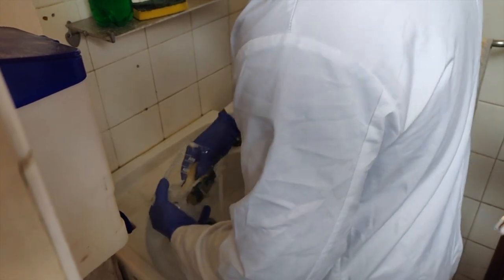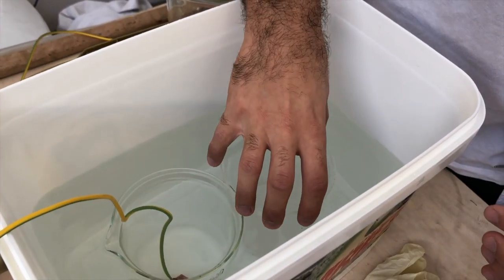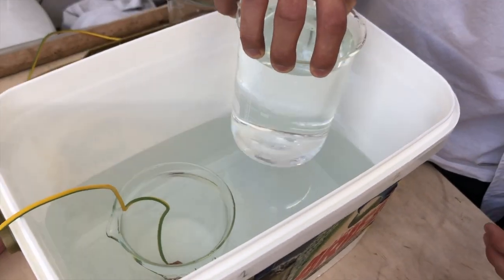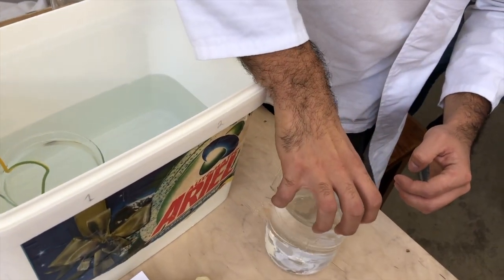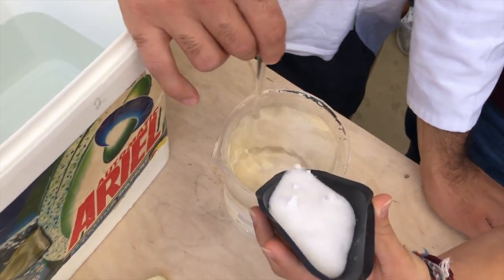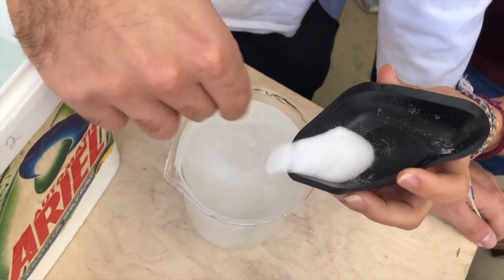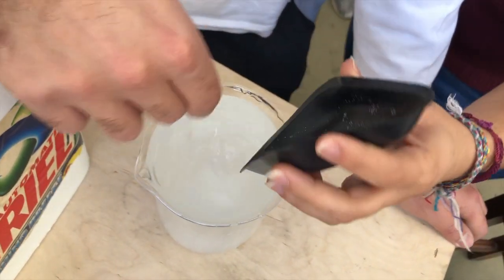For our second experiment, the solution was increased to double the amount of sodium chloride. This difference in both beakers produced an initial potential difference. This potential difference was a result of the imbalance in solution between the two beakers. The voltages recorded varied from 0.014 to 0.038 with agitation. Similar to the first experiment, these values indicate a similar region of corrosion.